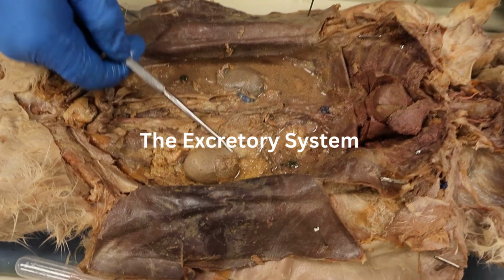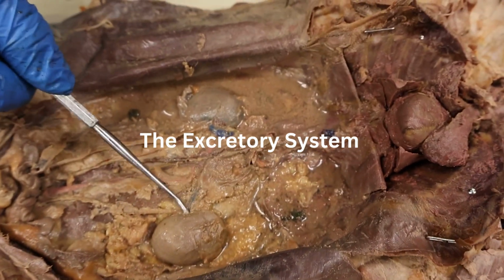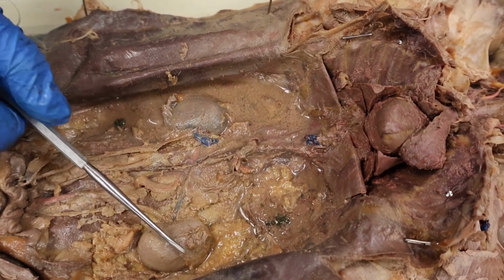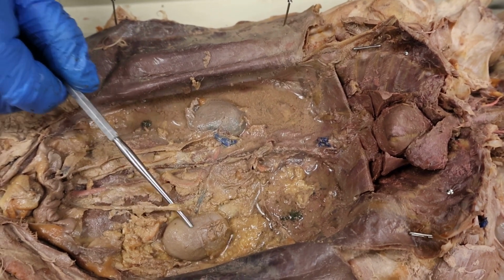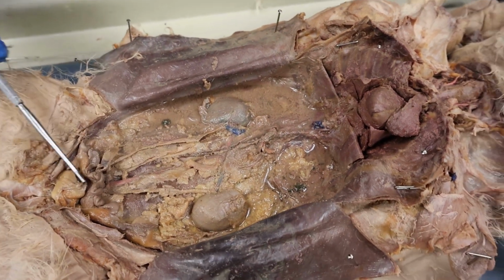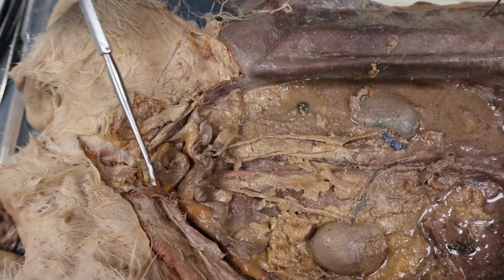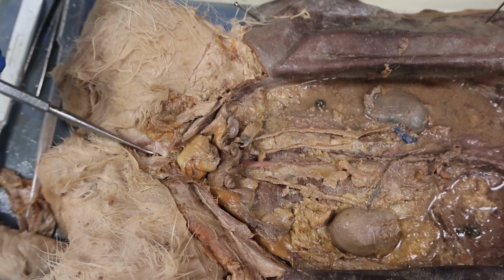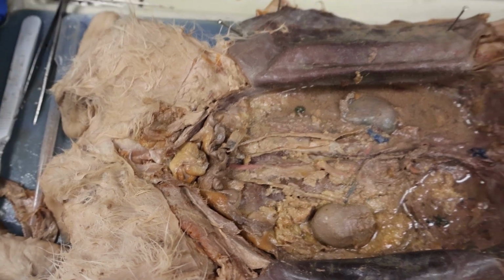So this is going to be the beginning of the excretory system. These are going to be our kidneys. They are going to filter out toxins and waste matter from the blood. The product of these kidneys is going to be urea. Urea comes down these ureters and into this bladder, where it combines with excess fluid, and from this fluid it goes down through this urethra and out the other end.